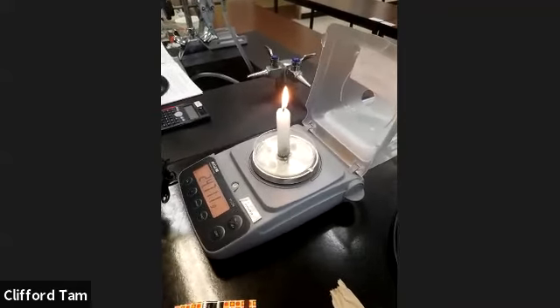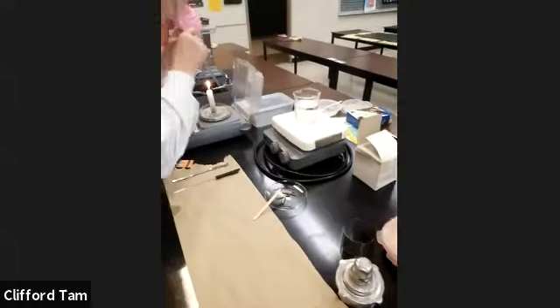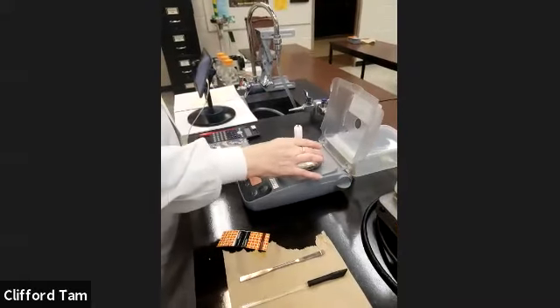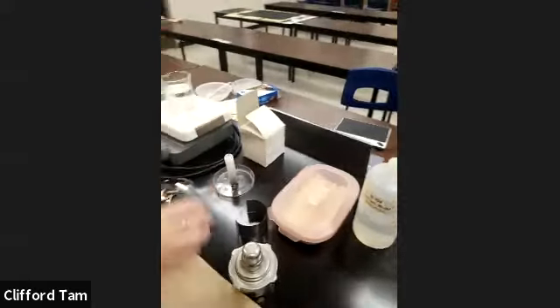So approximately that. Okay, so now we're just going to blow the candle out because we're not going to make you guys sit through the whole 3 minutes. That would be torturous. Absolutely torture.